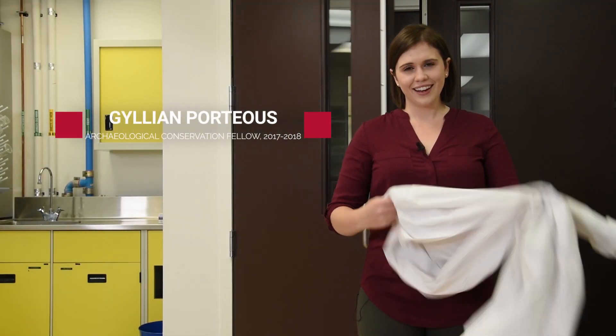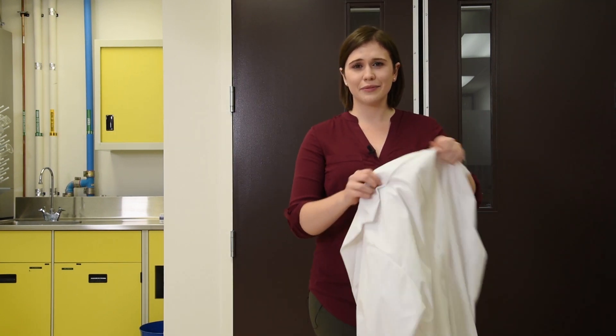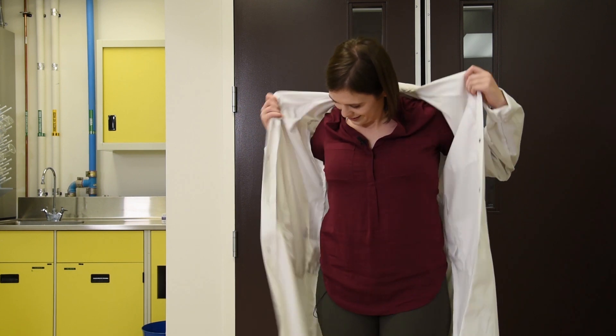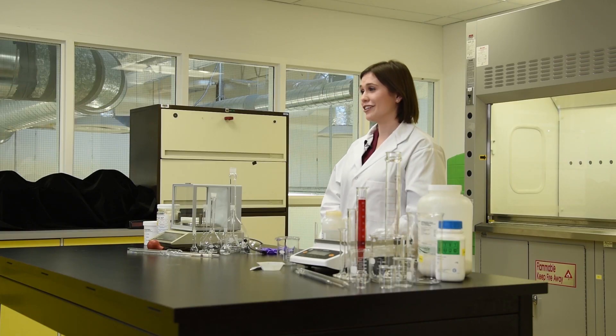Hey there, I'm actually just getting ready to make some solutions for a conservation treatment. Come along as I demonstrate the proper technique for preparing precise solutions for use in conservation.